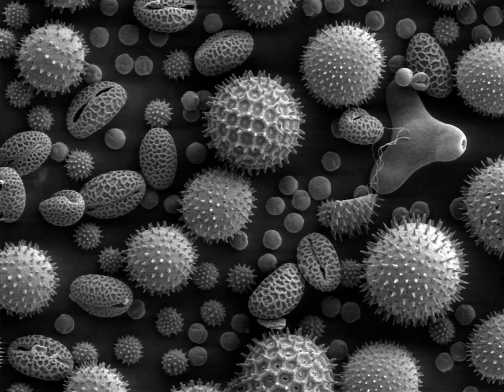The spot size and the interaction volume are both large compared to the distances between atoms, so the resolution of the SEM is not high enough to image individual atoms, as is possible with a transmission electron microscope. The SEM has compensating advantages, though, including the ability to image a comparatively large area of the specimen, the ability to image bulk materials, and the variety of analytical modes available for measuring the composition and properties of the specimen. Depending on the instrument, the resolution can fall somewhere between less than 1 nm and 20 nm. As of 2009, the world's highest-resolution conventional SEM can reach a point resolution of 0.4 nm using a secondary electron detector.